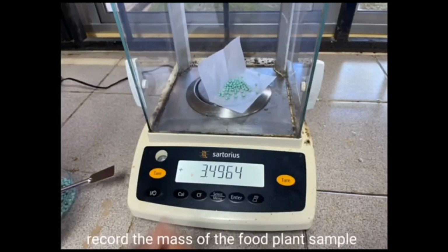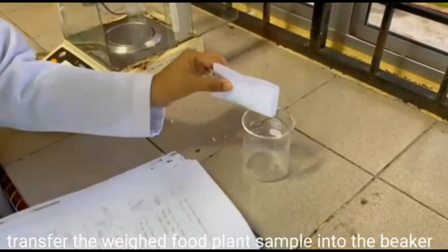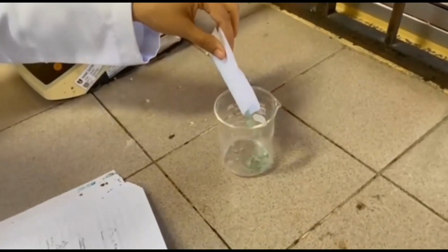Record the mass of the plant food sample. Transfer the weighed plant food sample into the beaker.